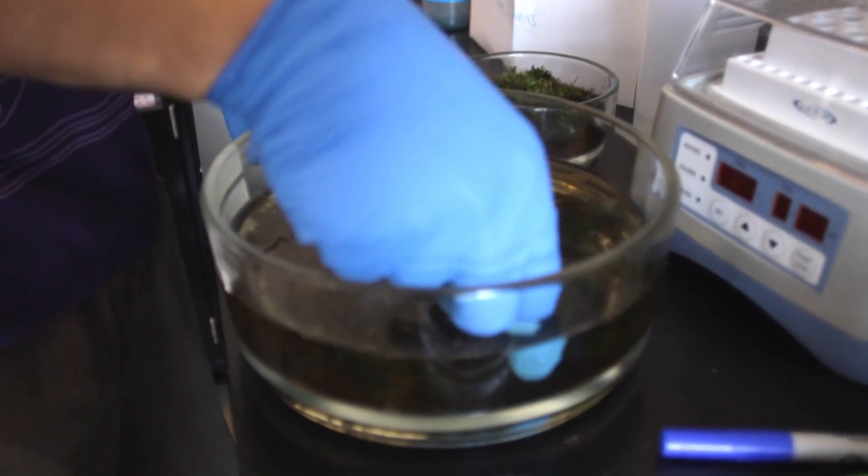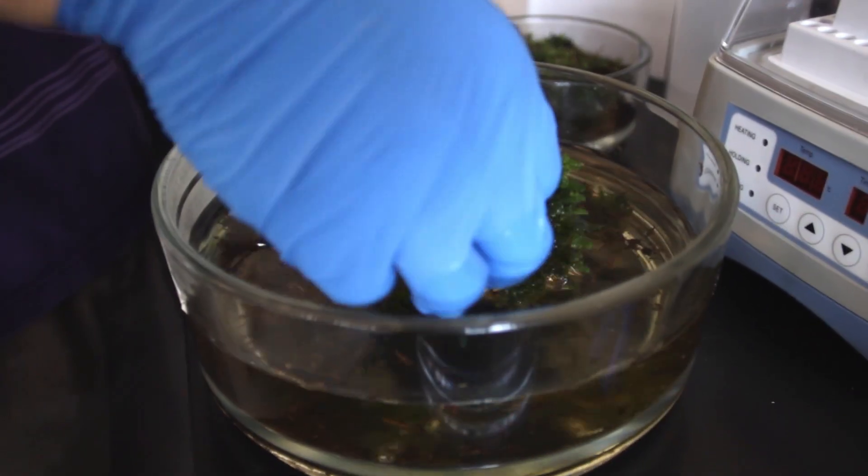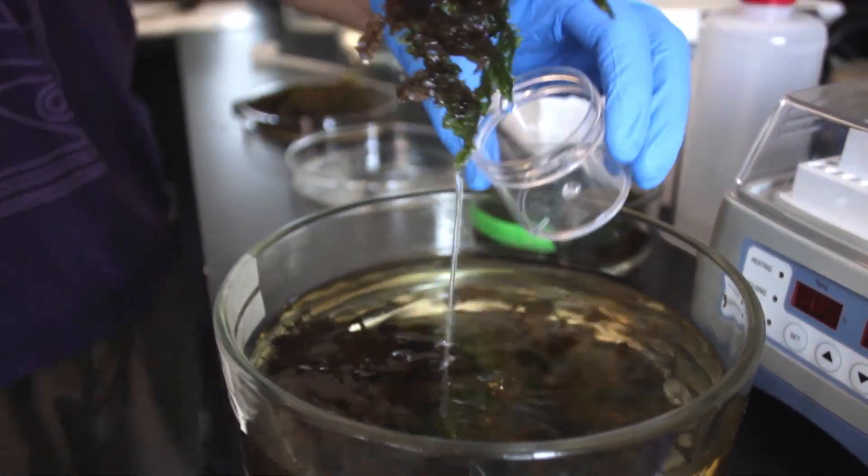So now that the moss is rehydrated, if there are any microorganisms in cryptobiosis they'll sense that there's water around them and they'll reanimate, so to speak. Now it can take a couple of hours to reanimate, but this is YouTube, so we're just gonna skip that.